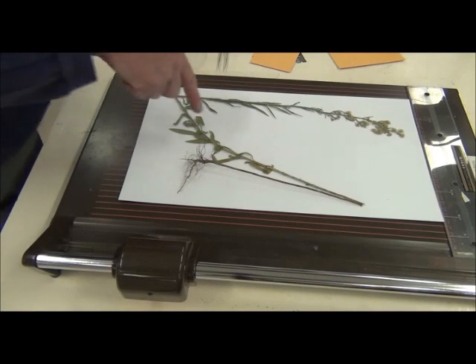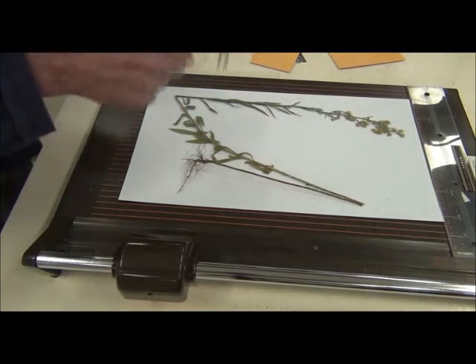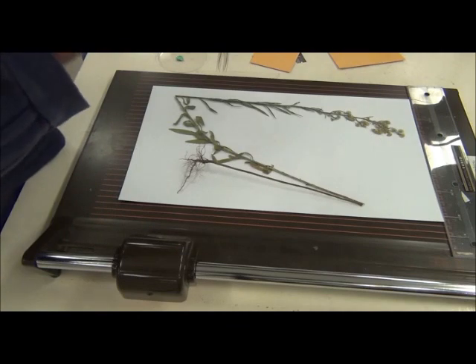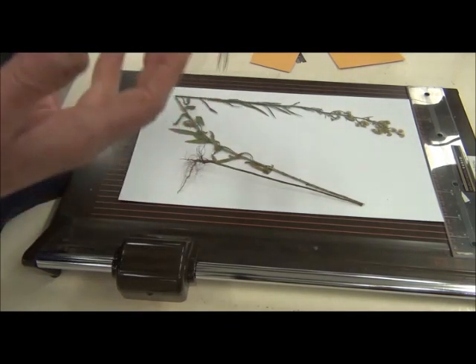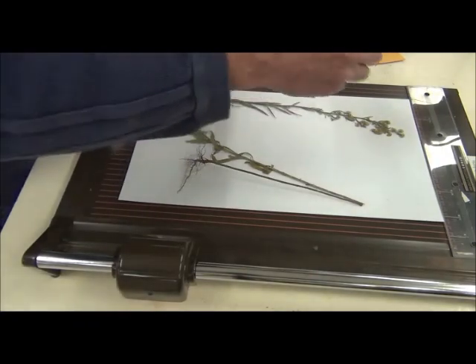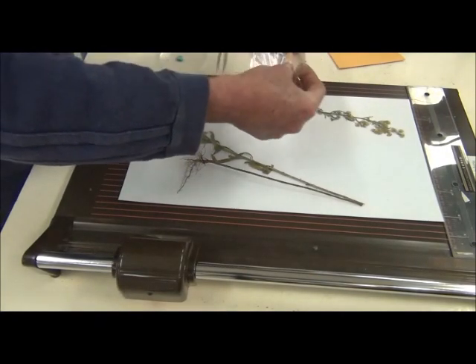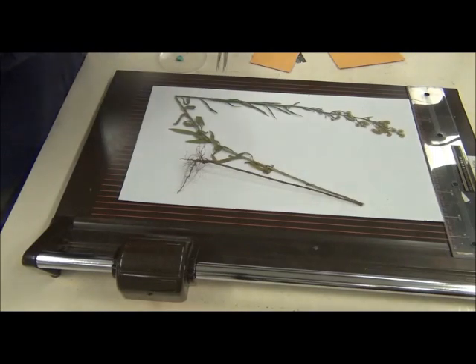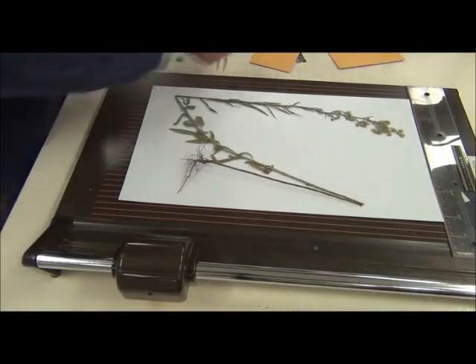Or, in this case, this bit doesn't have the label but the rest does, so I would copy exactly what was on that label so that you got the right thing. You would fold that bag over and you can fold it again.